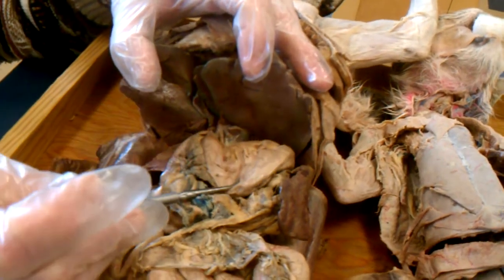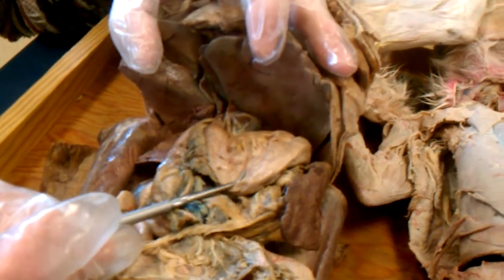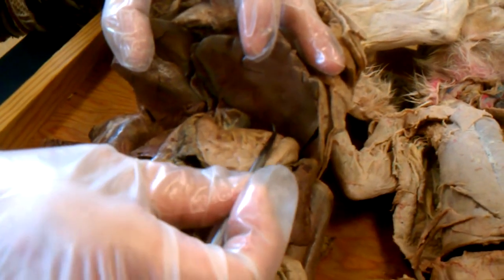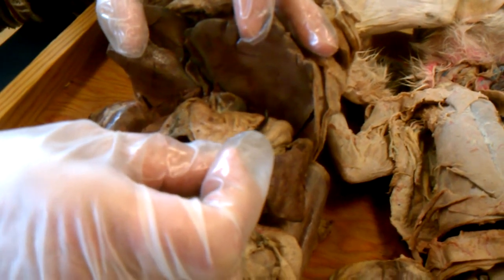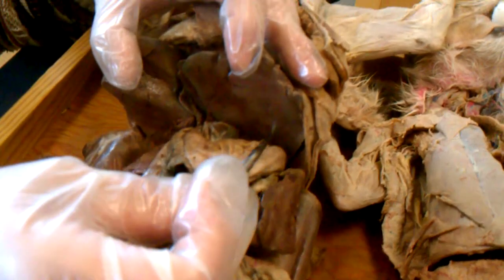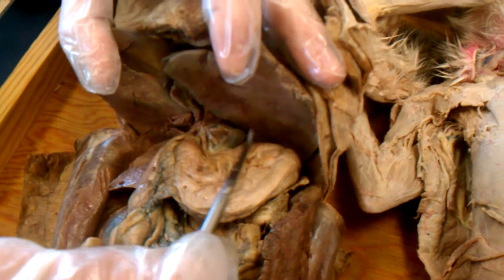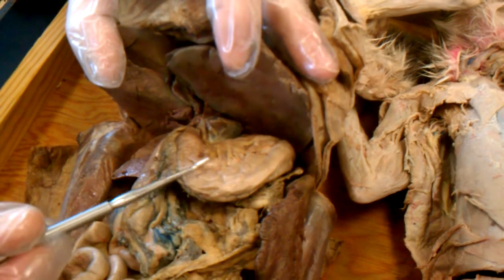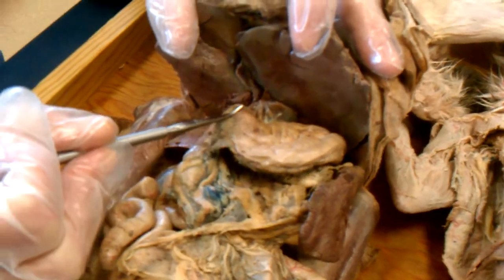Here's the stomach, sitting just dorsal to the left lobes of the liver. It's divided on its left portion into two subparts by a longitudinal line, with the portion on the very left, or very lateral, that expands as the stomach fills, being the fundus, and the portion that is medial being the corpus. From those regions, the stomach then bends around to the right and travels anteriorly.